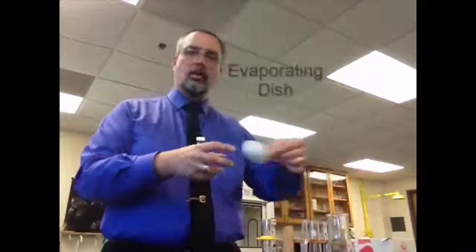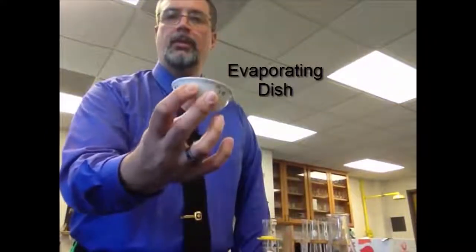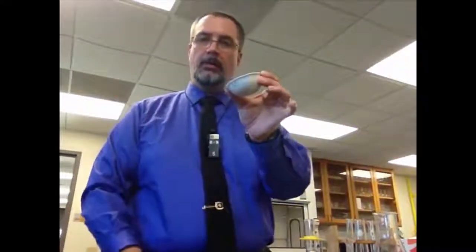If you do want to heat something in an open container that's not like a crucible, you can use the crucible's big brother. This is an evaporating dish, and you can put something in here and you can heat it very strongly. It's also made out of very strong porcelain. It will heat very well. You can put it in here and it'll evaporate whatever liquid might be in there. So evaporating dishes are better to evaporate liquids over heat.